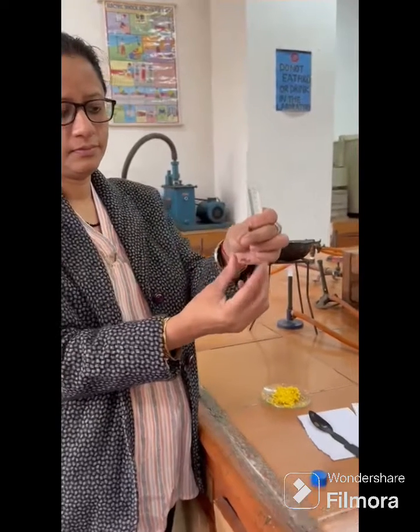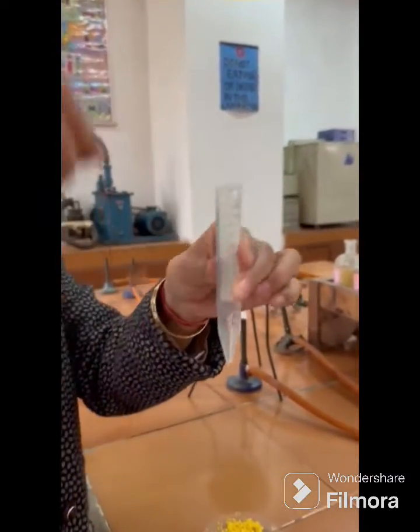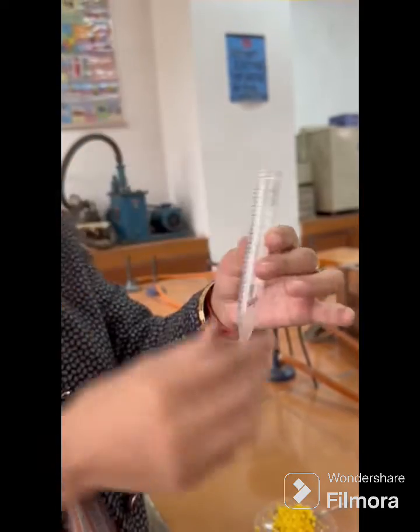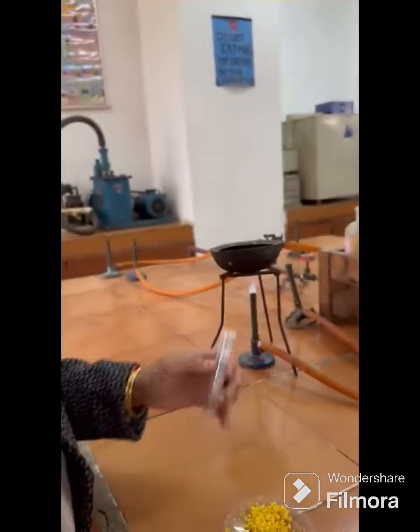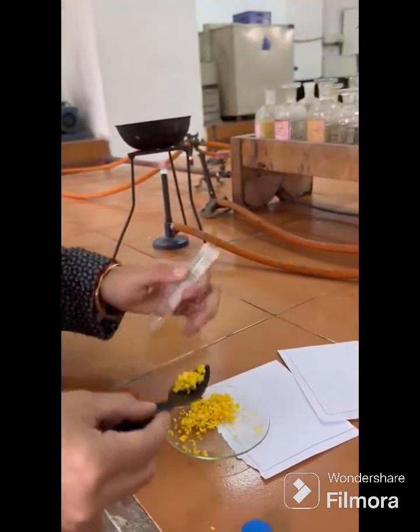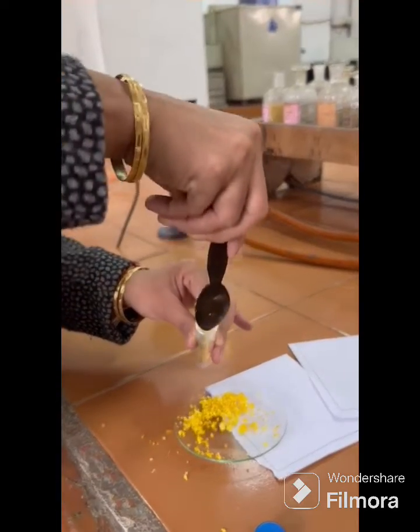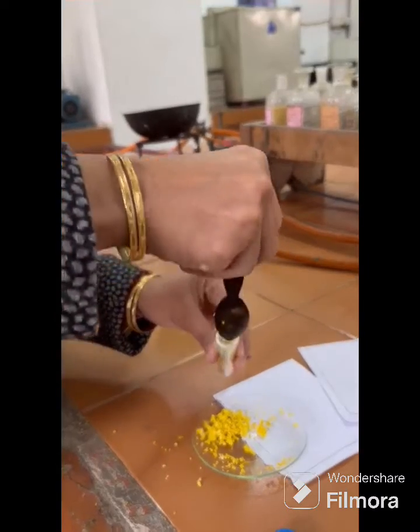We are going to isolate the limonene from orange peel. Construct a solid trap by bending copper wire into a coil and handle, and insert it inside the polypropylene tube. Grate the colored part of the orange peel and put it inside the polypropylene tube.